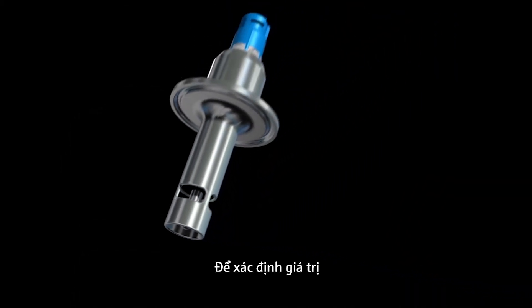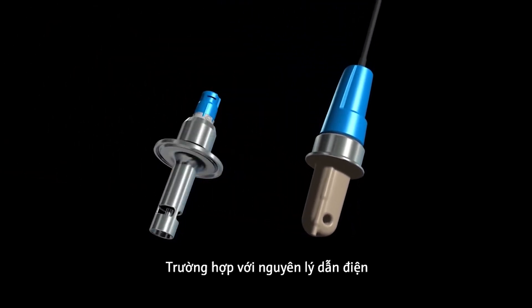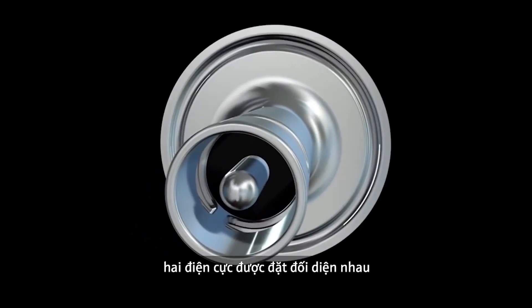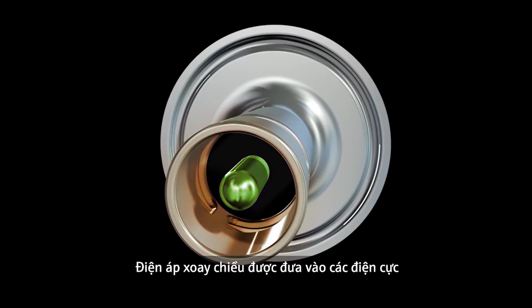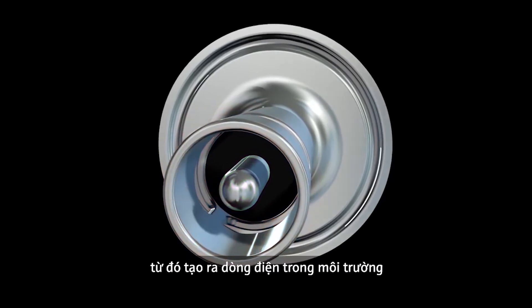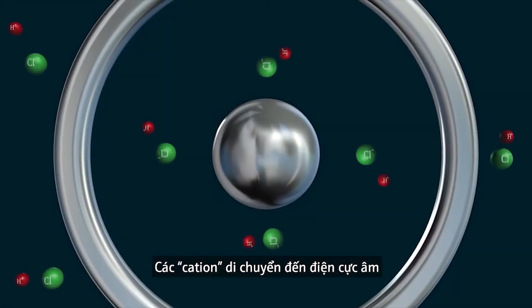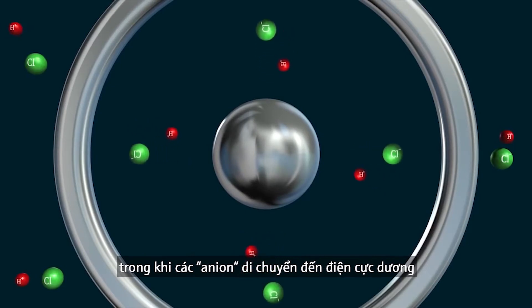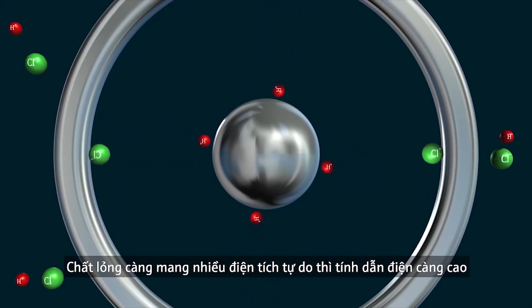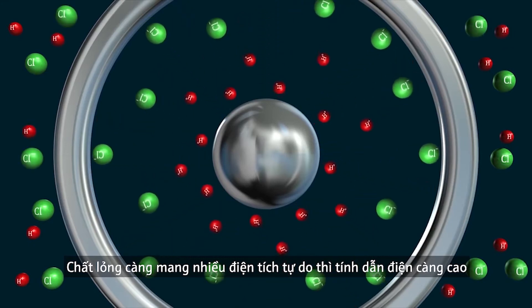To determine the value, the so-called conductive and inductive measuring principles can be used. In the case of the conductive measuring principle, two electrodes are positioned opposite from each other. An AC voltage is applied to the electrodes, which generates a current in the medium. The cations move to the negatively charged electrode, while the anions move to the positively charged electrode. The more free charge carriers the liquid contains, the higher the electrical conductivity and the current flow.